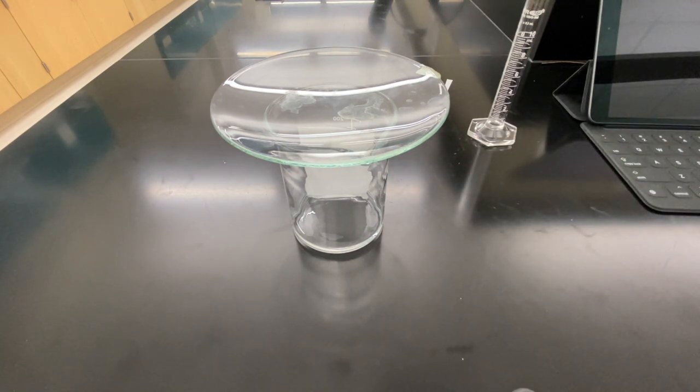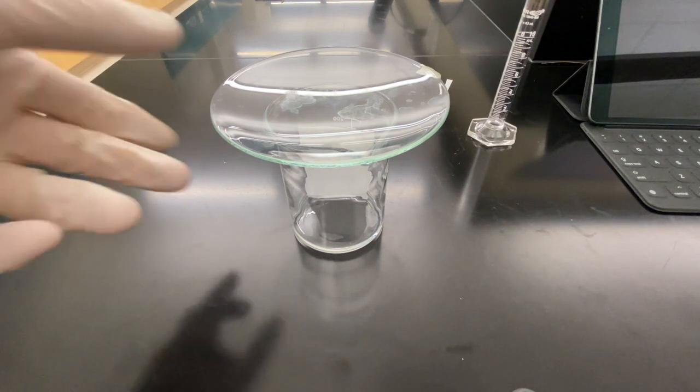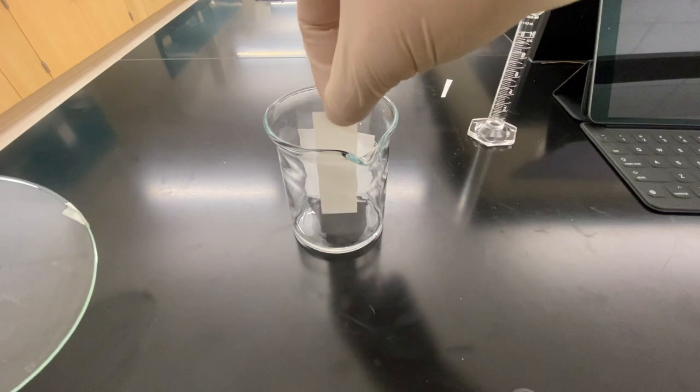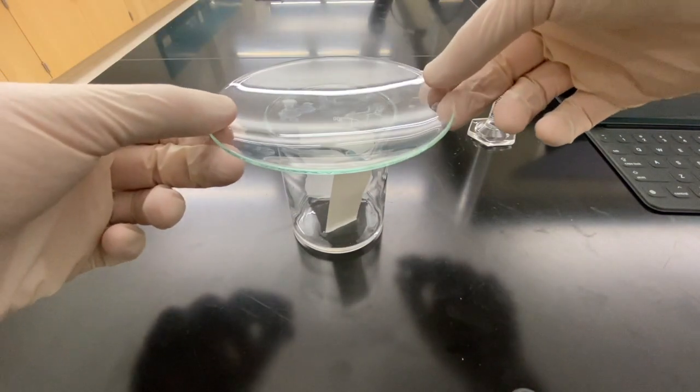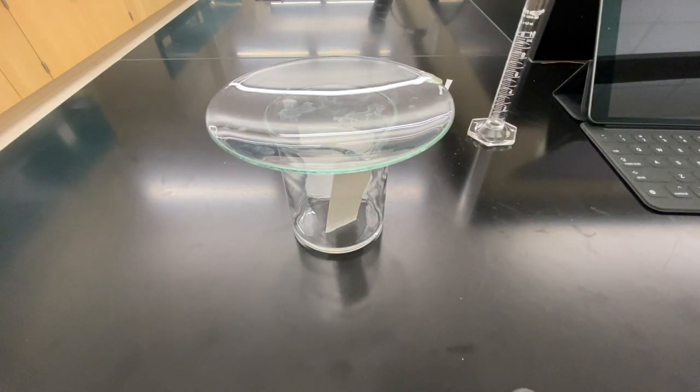We're going to add it on the opposite side from the wick like this. Usually you're going to want to have the silica side facing in, and then that's going to work its way up. I'll show you the finished result here in a second.